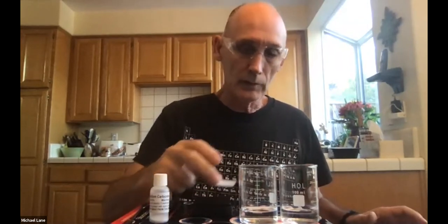So I'm going to pour this gently in there. And I know you can't see that. You're just going to have to trust me on some of this. There we go. Now, the measurement that I see is 1.47 grams.